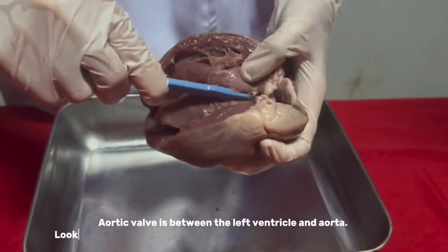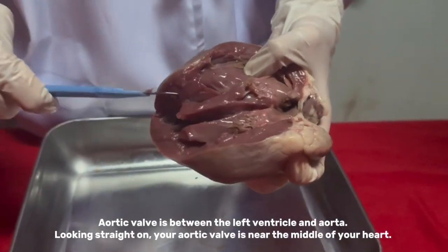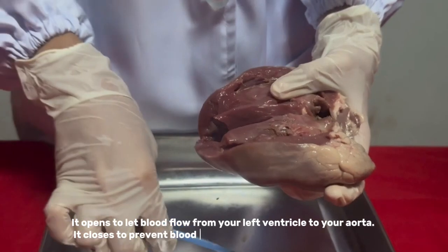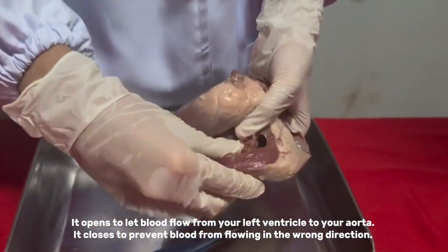The aortic valve is between the left ventricle and aorta. Looking straight on, your aortic valve is near the middle of your heart. It opens to let blood flow from your left ventricle to your aorta, and it closes to prevent blood from flowing in the wrong direction.